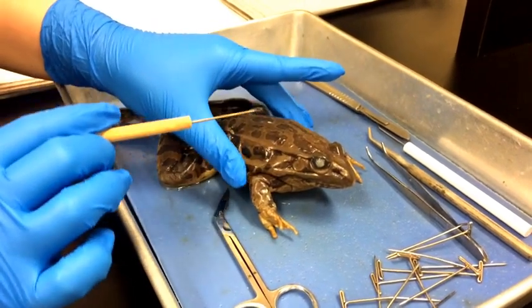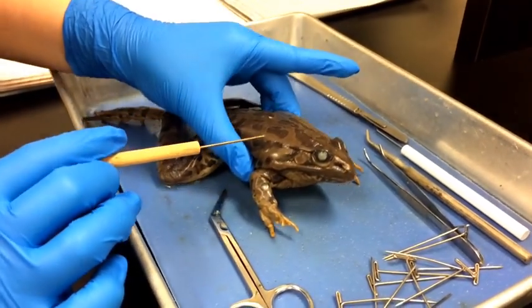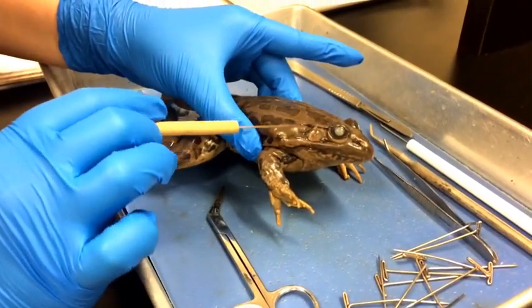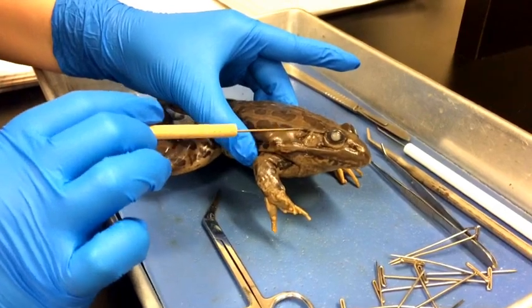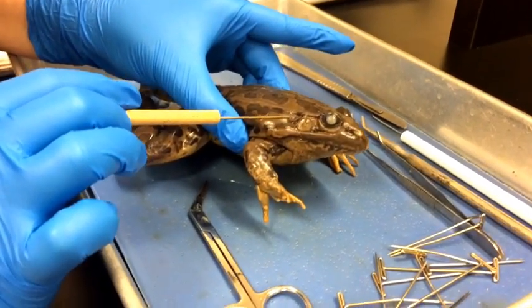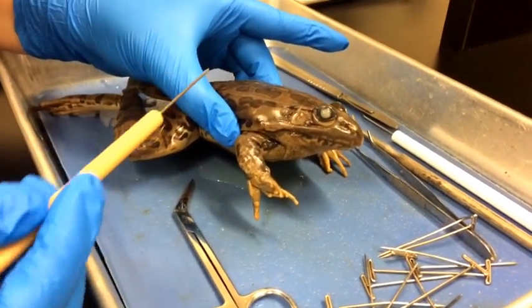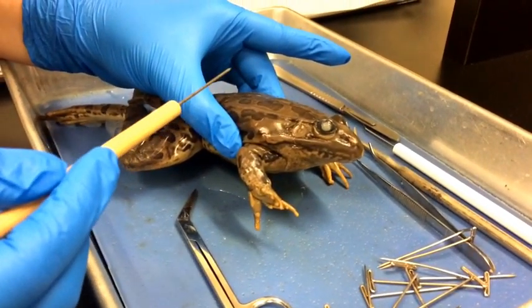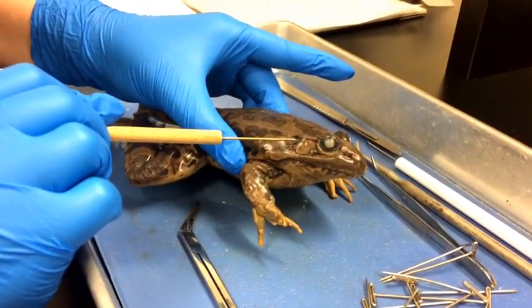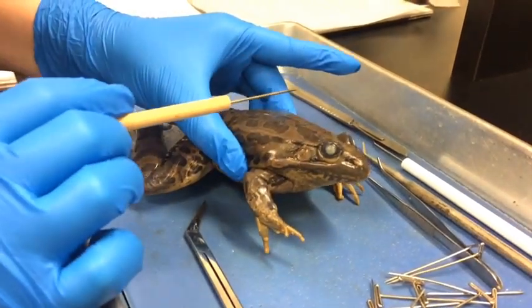Moving on from the integumentary system, we're going to move on to the nervous system. In the nervous system, we're going to talk about the nostrils, the eyes, and this little guy — the tympanum. The tympanum is actually the frog's eardrum. It's a membrane that transmits sound waves into the inner ear, and it also protects the inner ear from water and debris from entering.